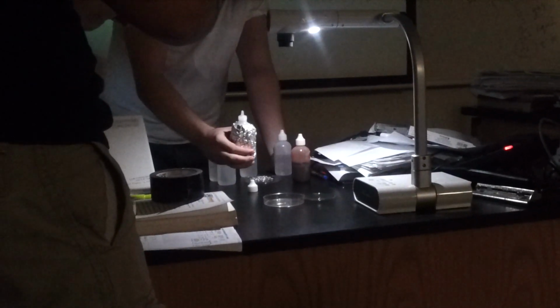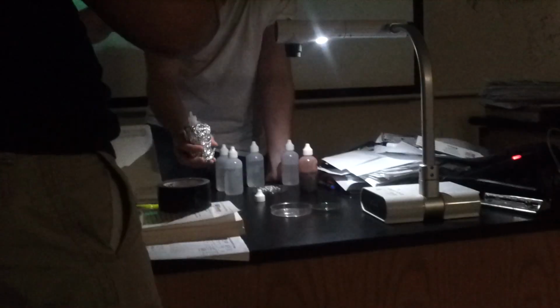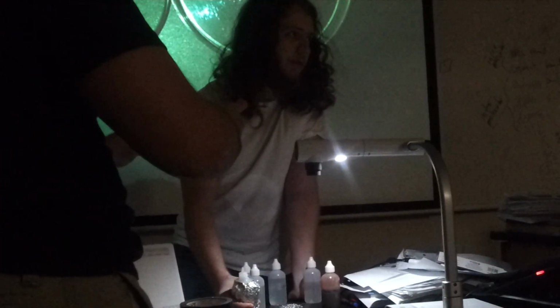I think I'm going to try to do a redox indicator later on this year. They're pretty cool. You can have any indicator for anything. It doesn't have to be pH or redox. It can be anything, as long as you have a significant color change or appearance of something that you can see. And the geology guy came last week. We learned you could have rock indicators. That's awesome. So here I'm adding the malonic acid first.